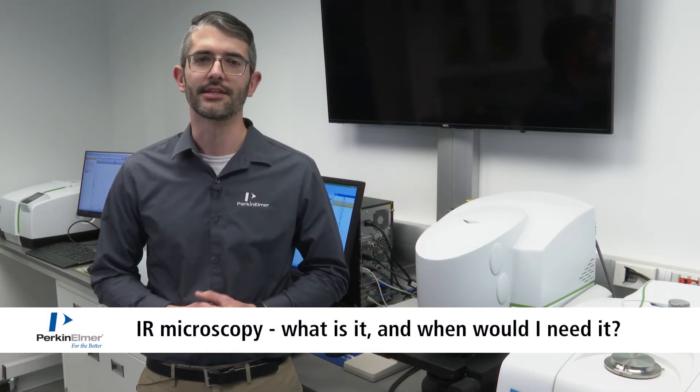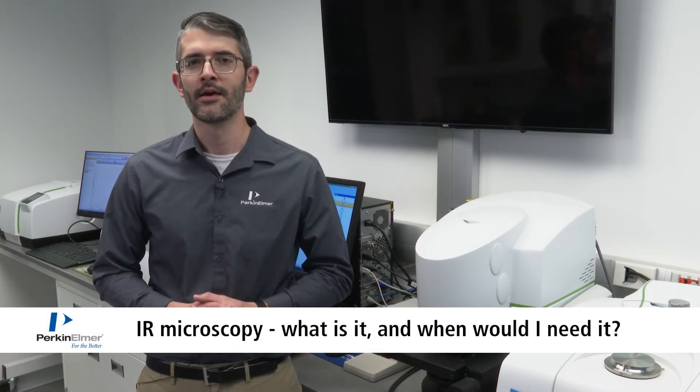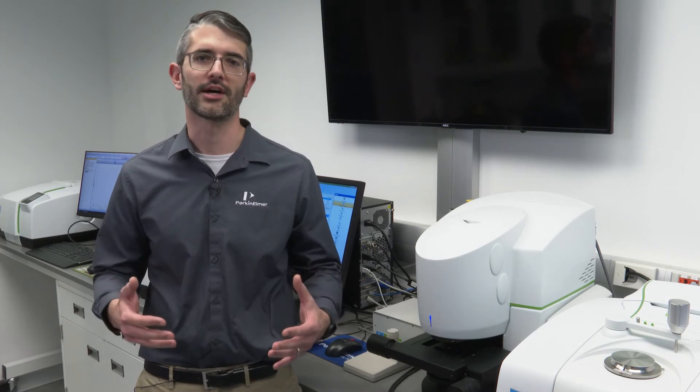Customers will often ask how to analyze contaminants in their samples. You may think of contaminants as falling into one of two categories. In one category, the sample material is contaminated by a small amount of foreign material, which is then diluted through the entire body of sample material, causing that contaminant to be present at some low concentration throughout. In the other category, the contaminant is a particle which falls in and remains a discrete body of foreign material.